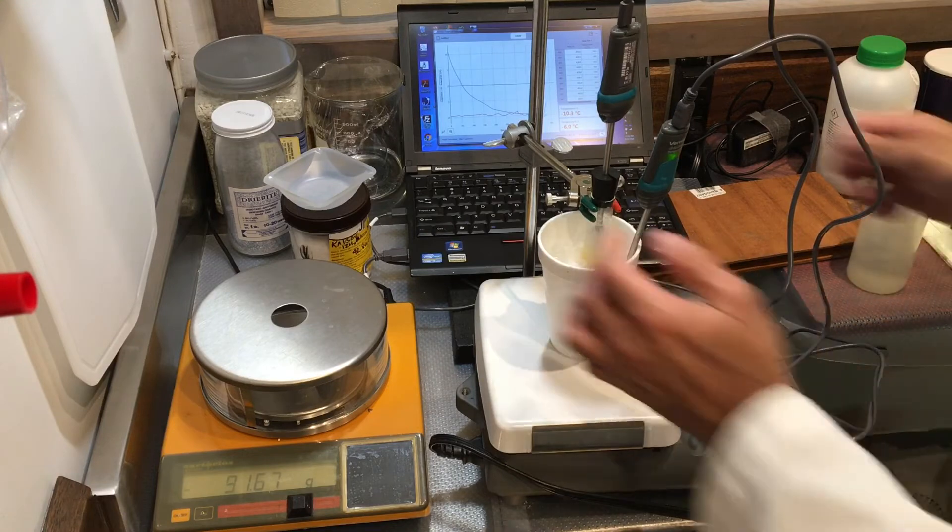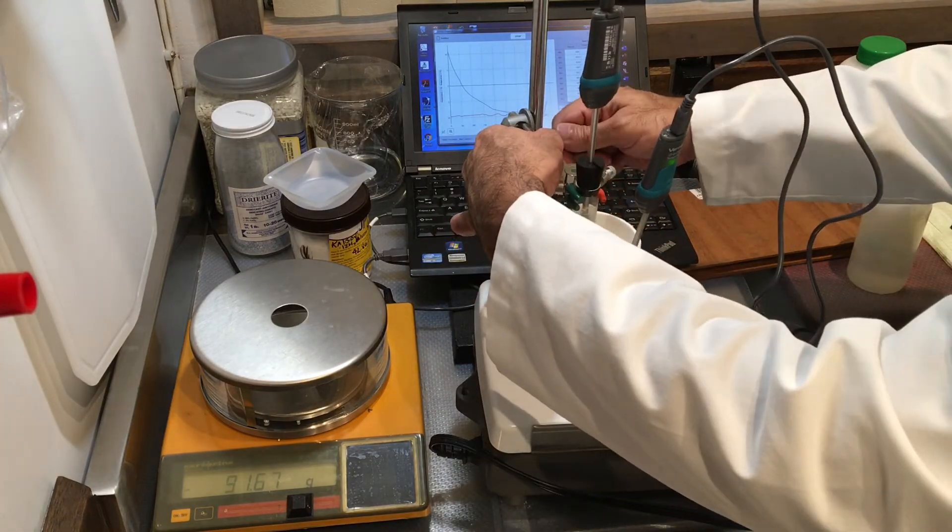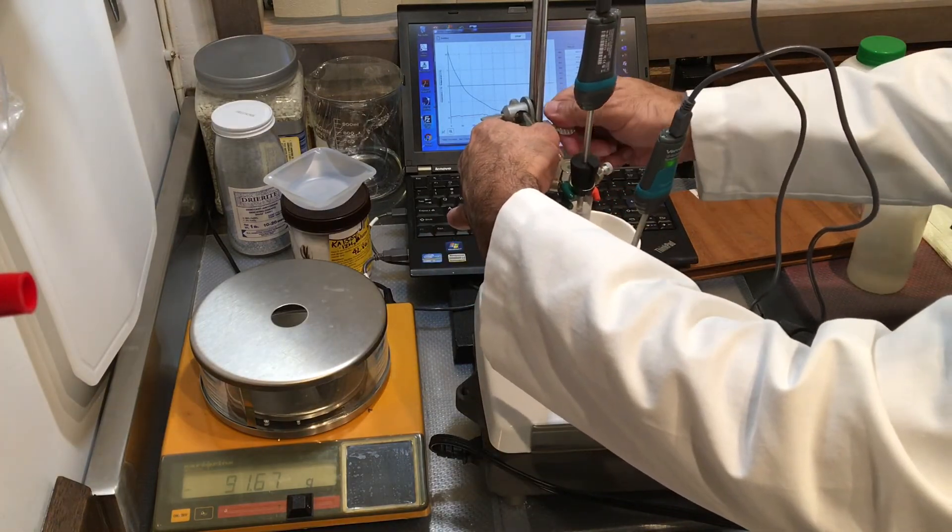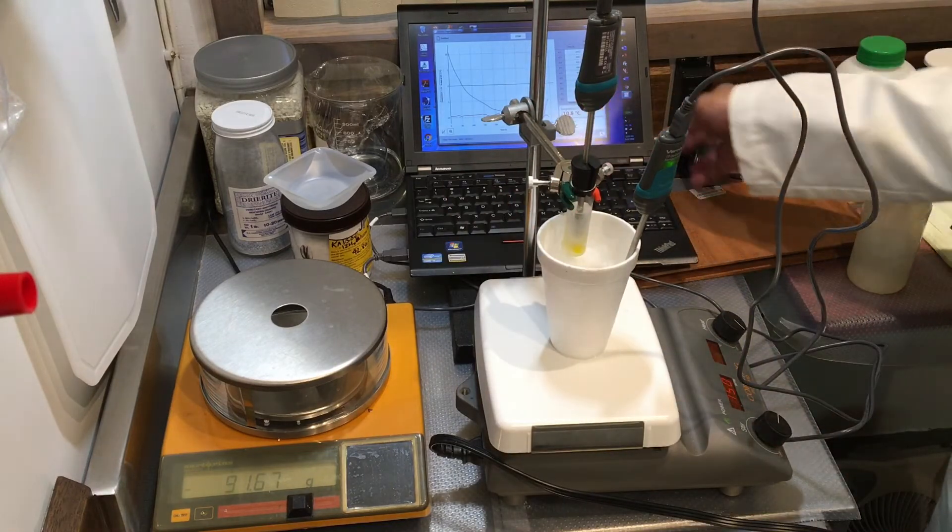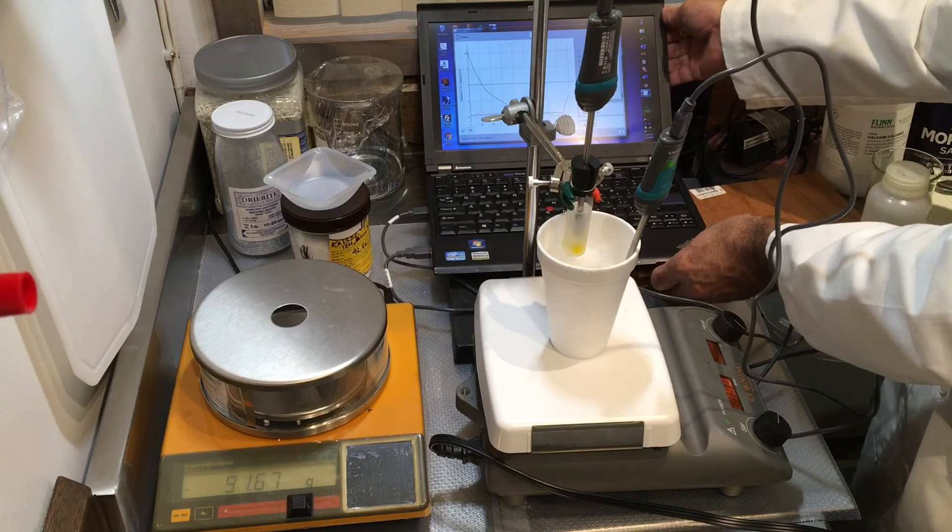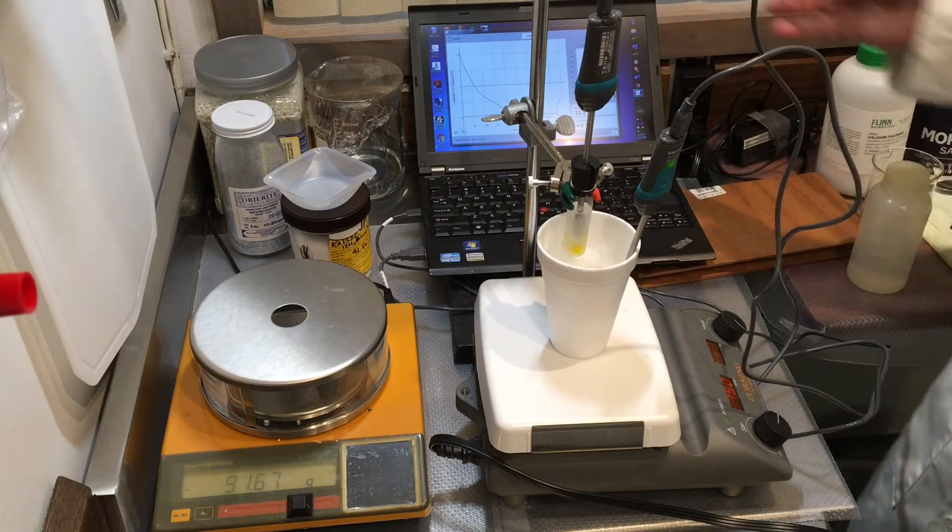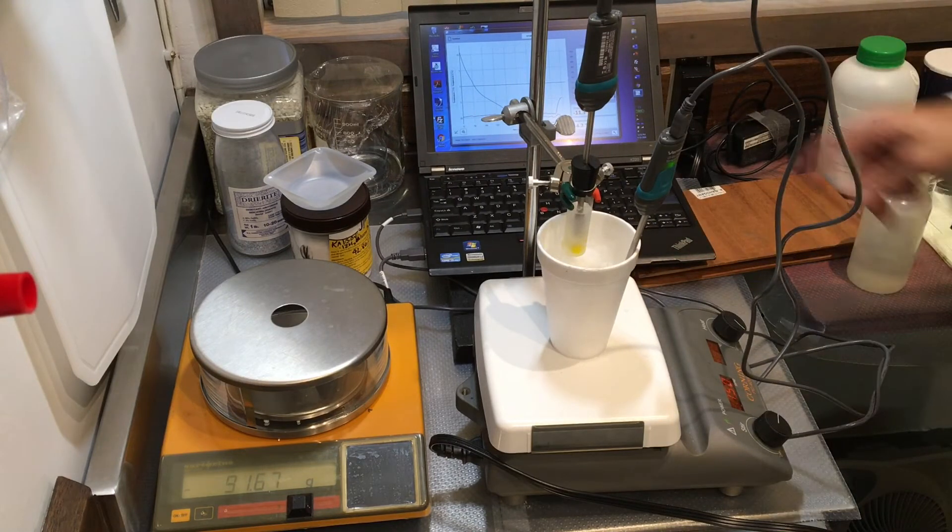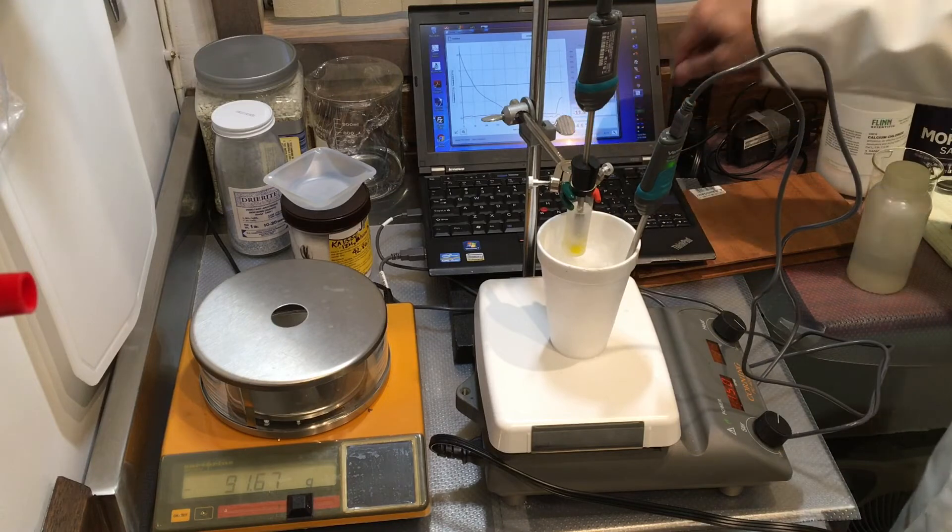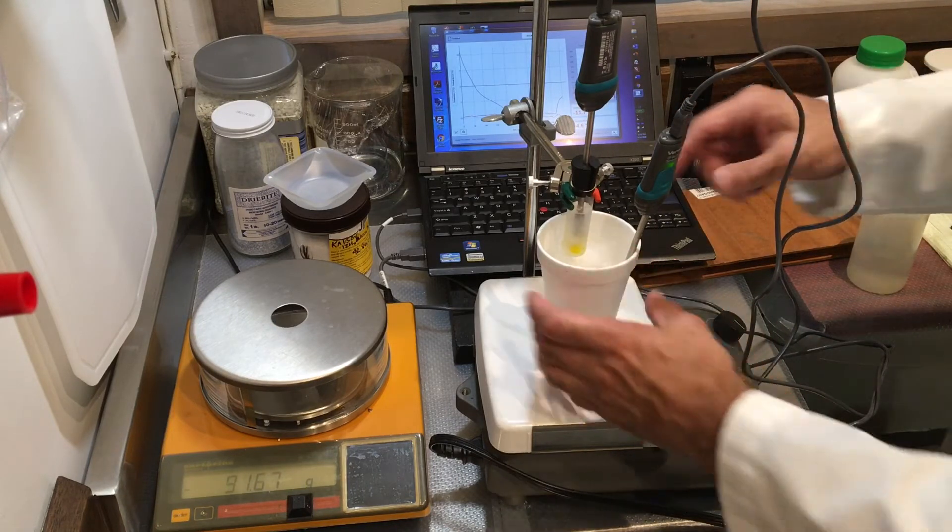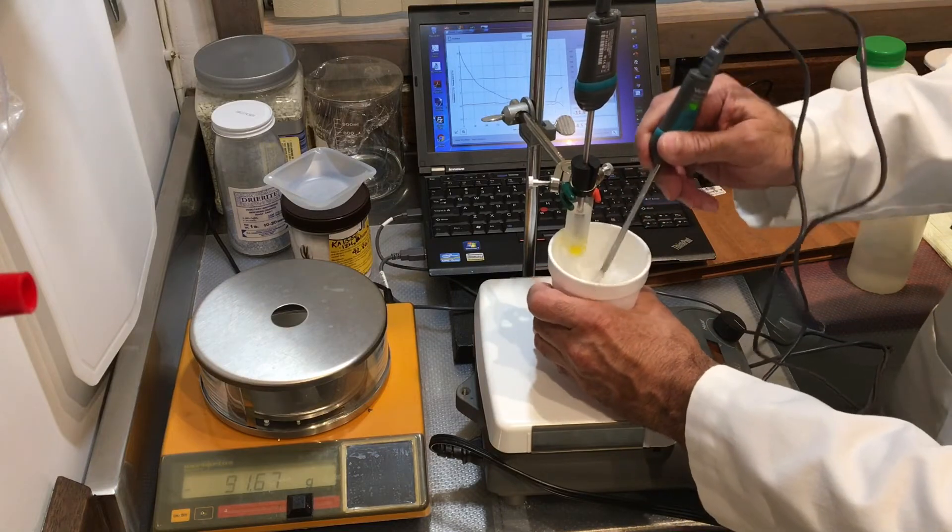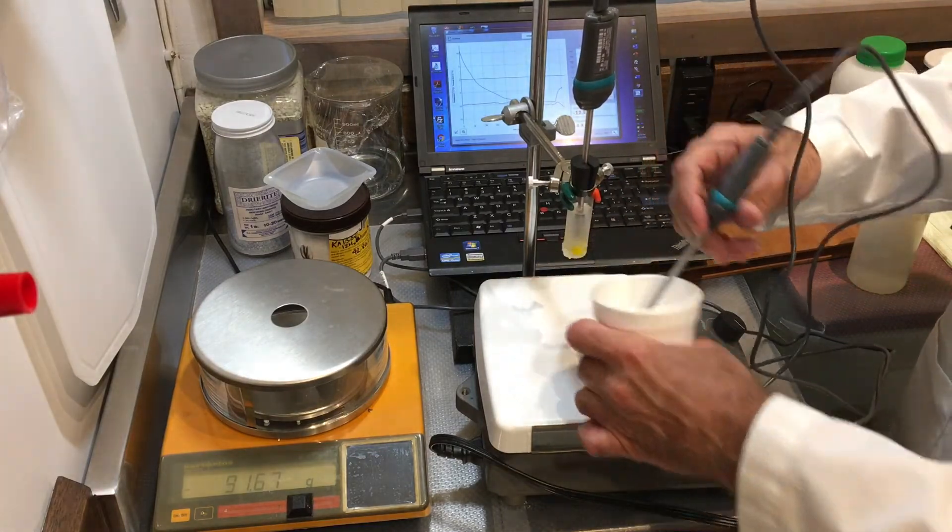I think it froze, there it is, something happened, you can see it actually right here. Or, I think you see it right in between the probe and the stand, right there. So it is frozen, it's clearly frozen right here. Without doing anything, I'll keep my ice water bath for the next run.